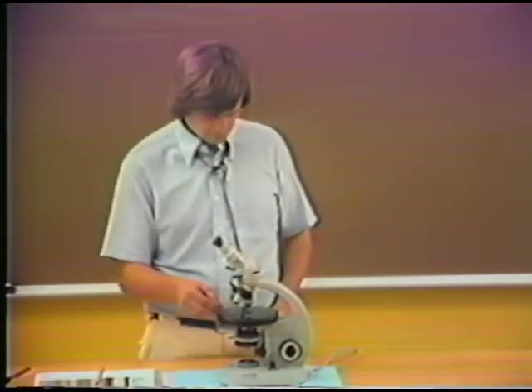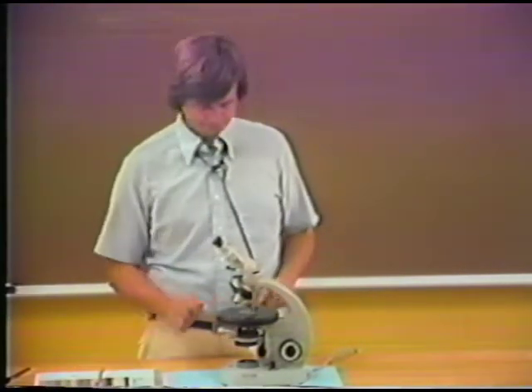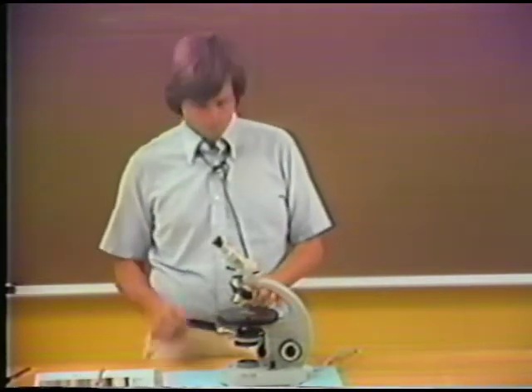This one, a mount of some elongate minerals. Here we are looking at these minerals now in plain polarized light, and I'll cross the polars, and you can see that they show very nice interference colors, and they move to extinction four times during rotation. But I'm going to indicate the position of the crosshairs on the field of view here, and I want you to notice when extinction occurs in these crystals compared to the orientation of the crosshairs. As I indicate right now, the grain is going to extinction, and it goes to extinction at a time when it is precisely parallel to the crosshairs.